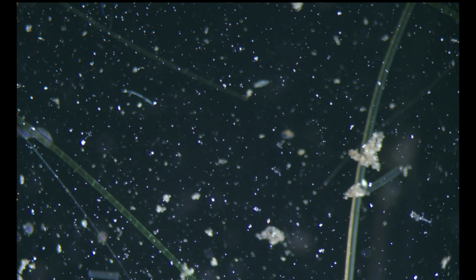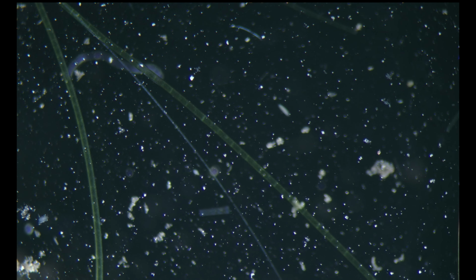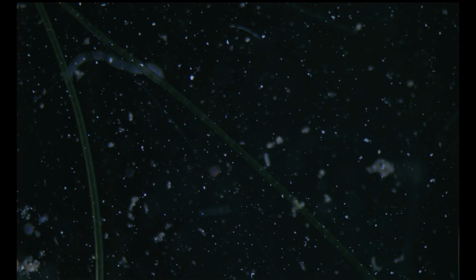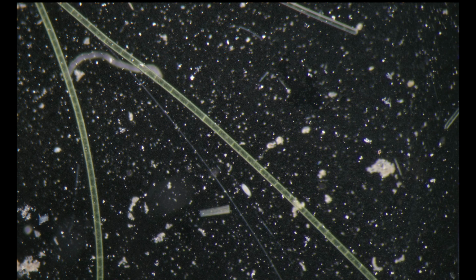There are also other techniques to create dark field illumination for stereo microscope using circular LED lights, etc. You can find it on the web by searching. So I'll turn the flashlight off and back to our base, which is more powerful.